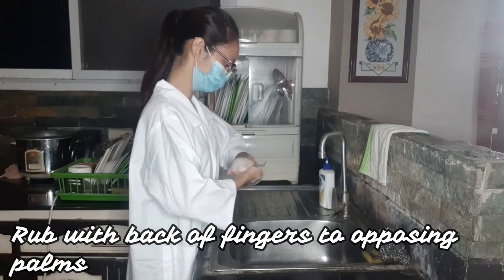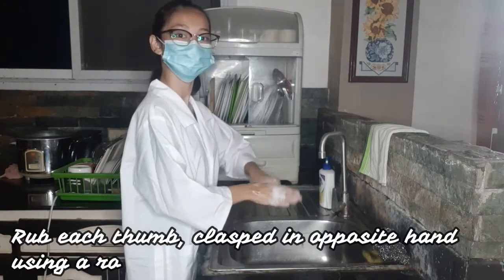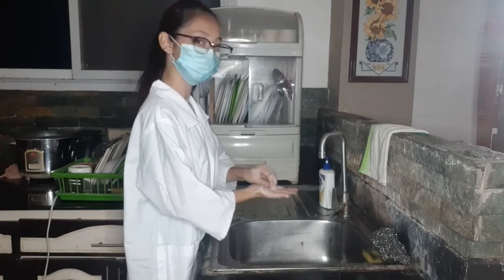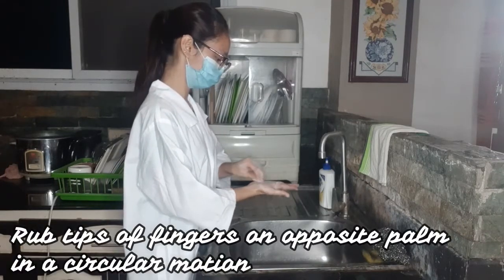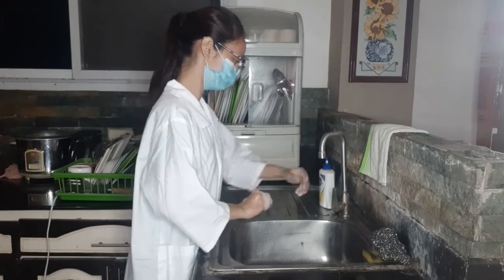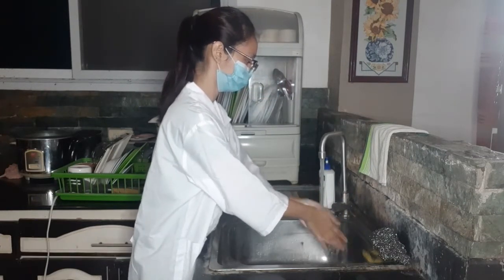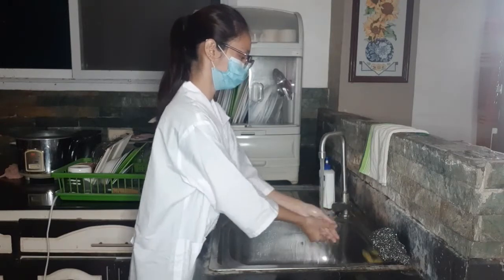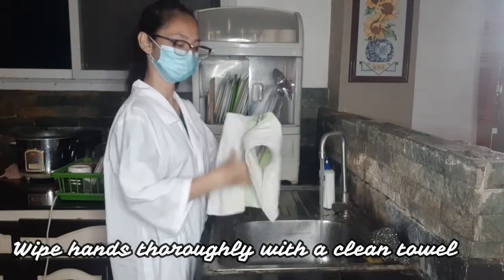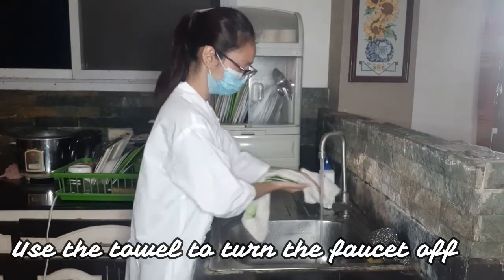Rub the back of your fingers to opposing palms. Rub each thumb clasped in opposite hand in a rotational movement. Rub tips of fingers on opposite palm in a circular motion. Rinse your hands with water. And wipe hands thoroughly with a clean towel. Use the towel to turn the faucet off.